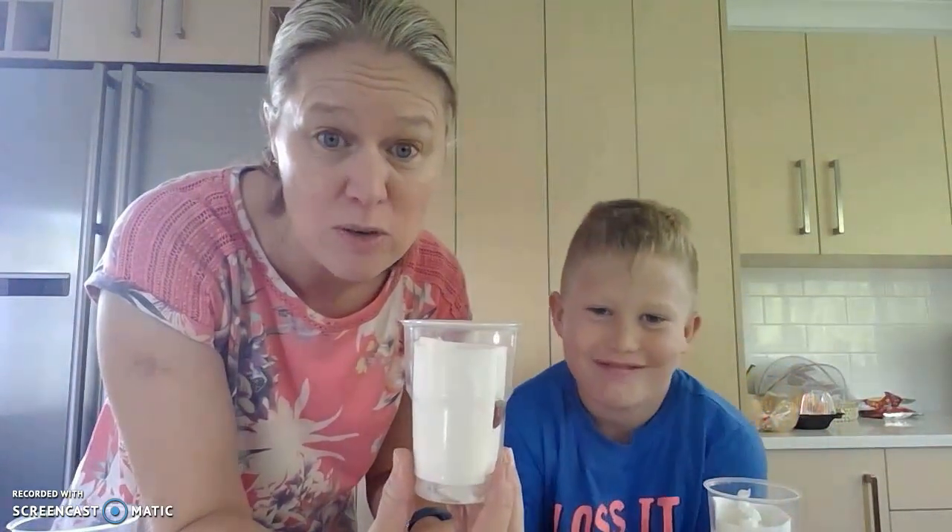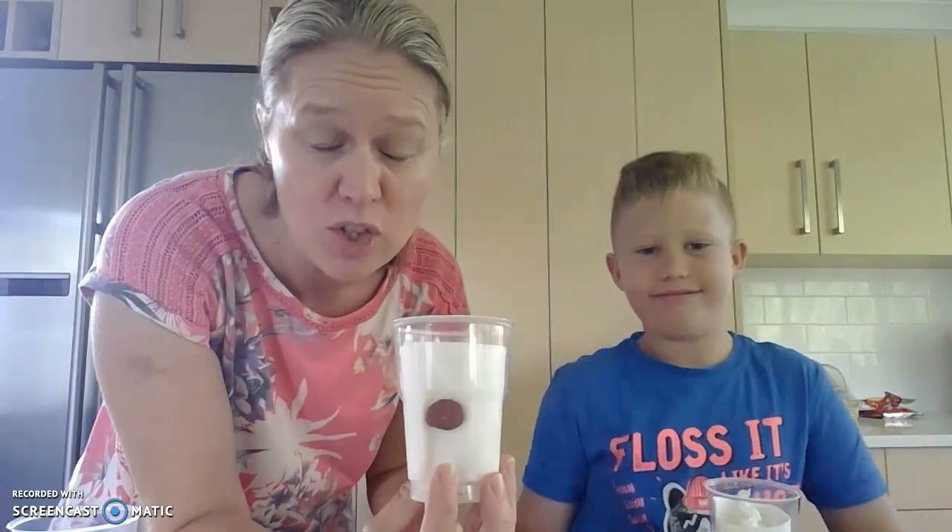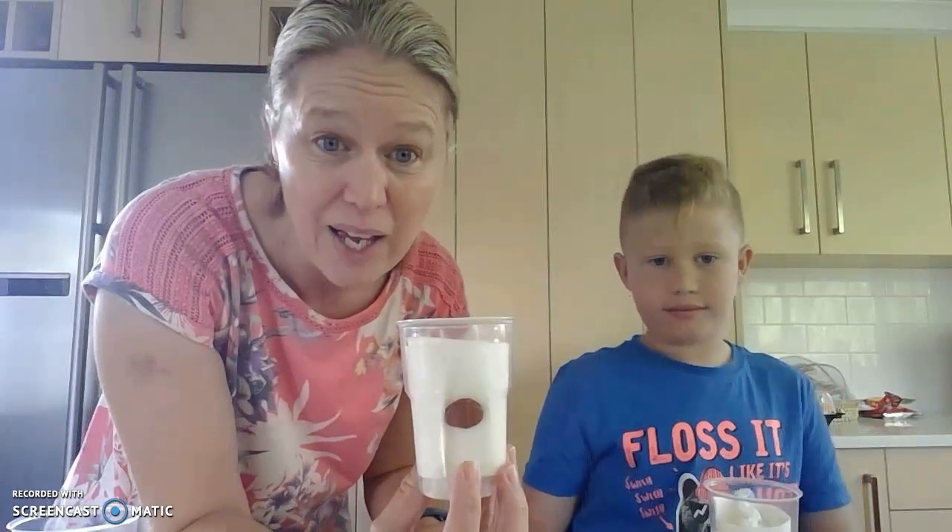And then what Thomas and I are going to do is take some photos of the roots and shoots as they start appearing, and then I'm going to explain to you how this happens due to geotropism.